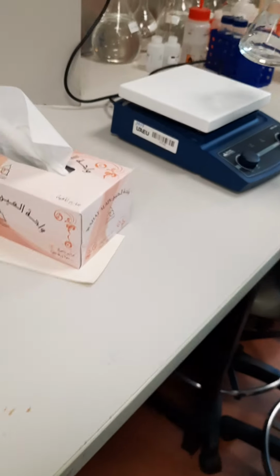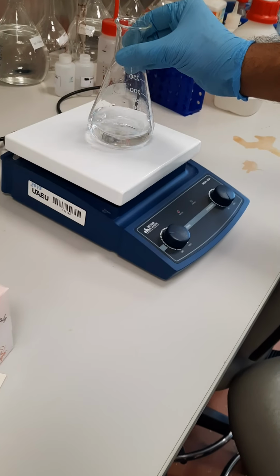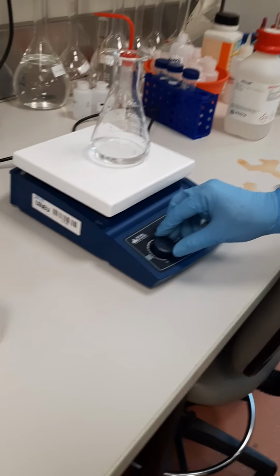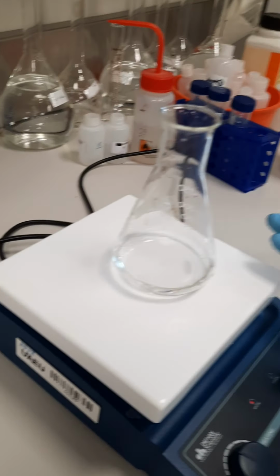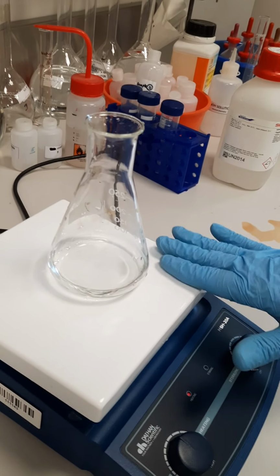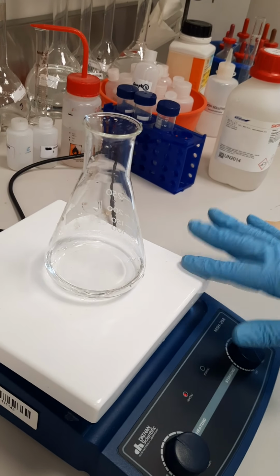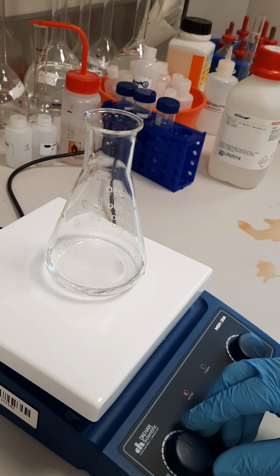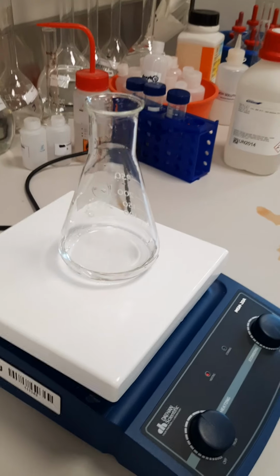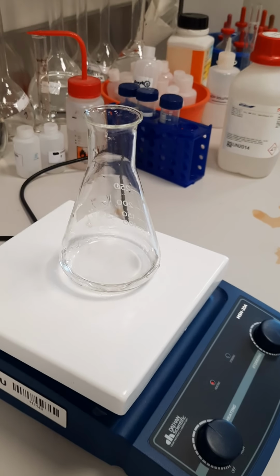However, we should heat the sample before starting the titration. I think already you have the information about that, because the reaction between oxalate and the KMnO4 is slow at room temperature. So we should increase the temperature to increase the speed of the reaction.